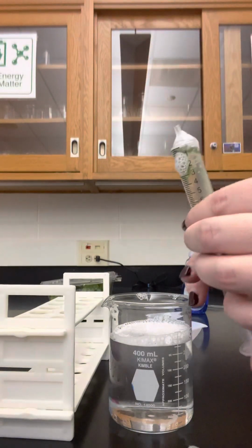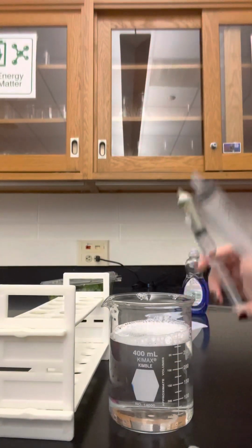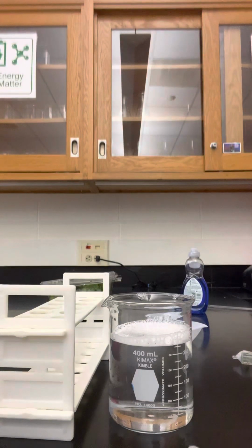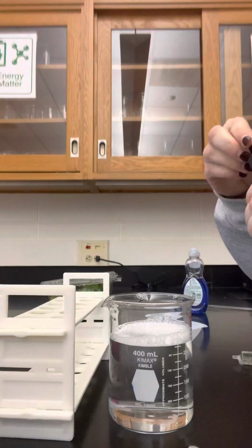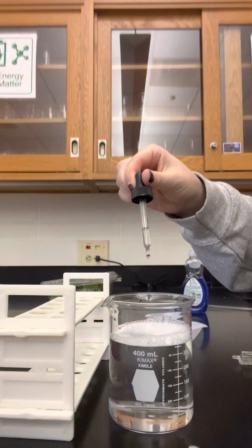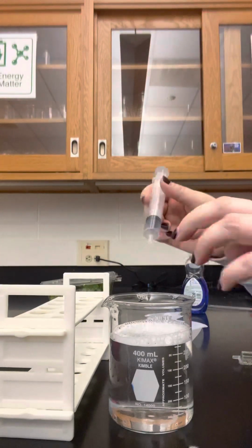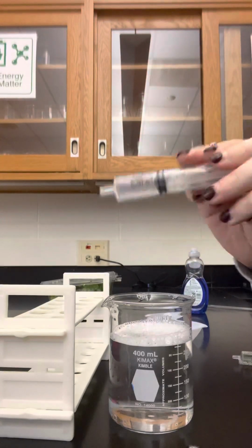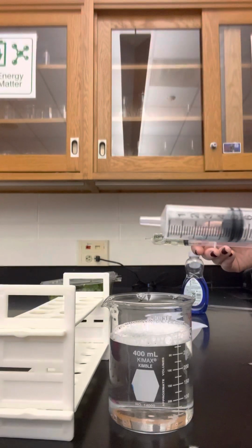You want to try to set up both syringes at the same time, so that you can start them at the same time. So let's say my variable is that I'm testing the pH of the solution. I'm then going to modify this solution by adding in a couple of drops. Some of you might be changing something else about the experiment and you won't need to do anything to this solution. But if you need to modify that solution in some way, now would be a great time to start this other syringe at the same time. So you want to have both syringes ready to go at the same time, okay?